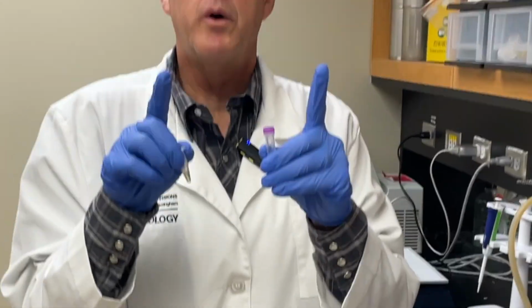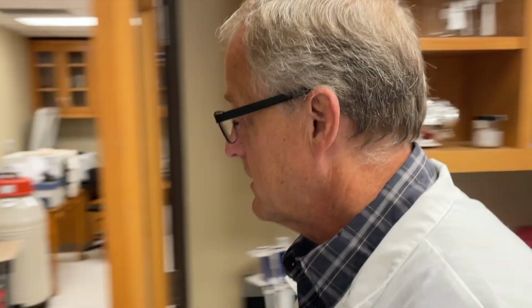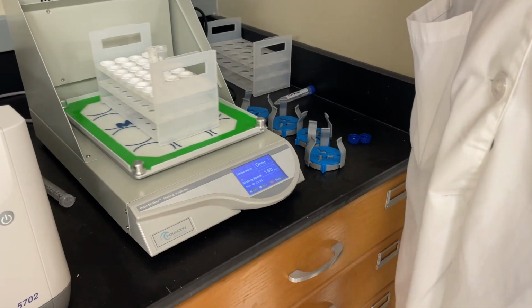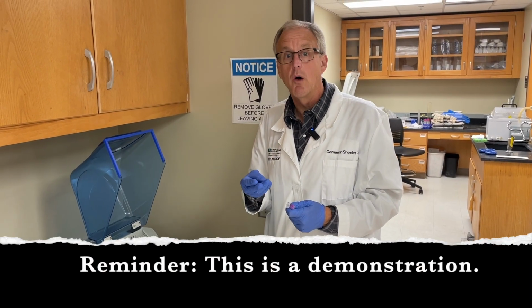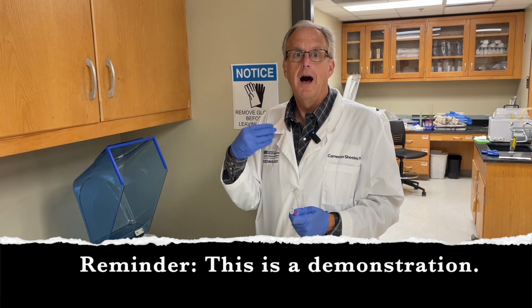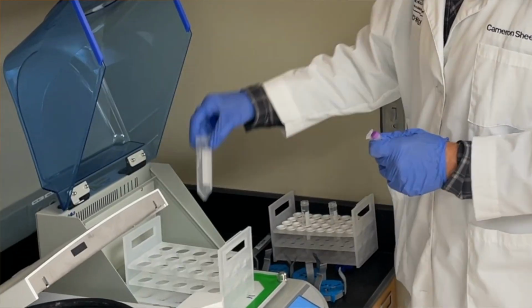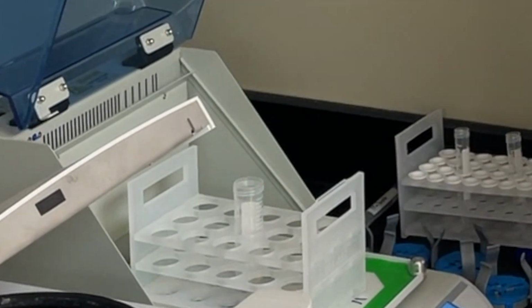Turn this off. We're not done. Now we're going to put it in a shaking incubator set to 37 degrees Celsius. And I have RPM set at 225 for 30 minutes. The original protocol was for 1 hour, but again, I have a 2-hour lab that all this has to get done in 2 hours. We will put a 50 ml conical tube in here, drop in our bacteria and plasmids, shut it for 30 minutes.